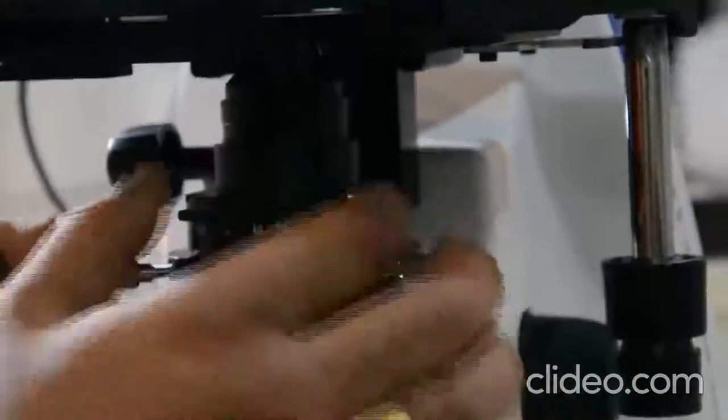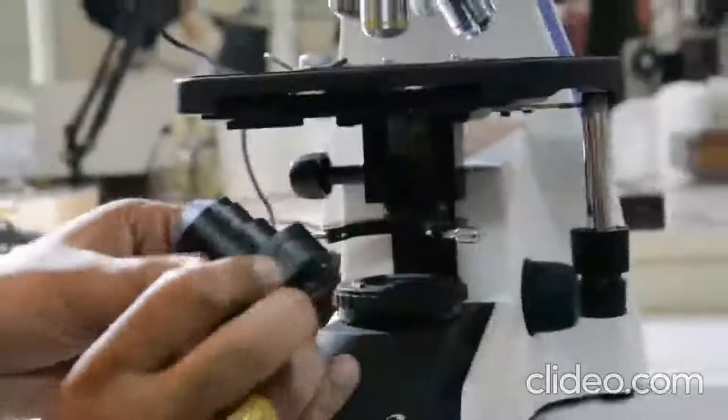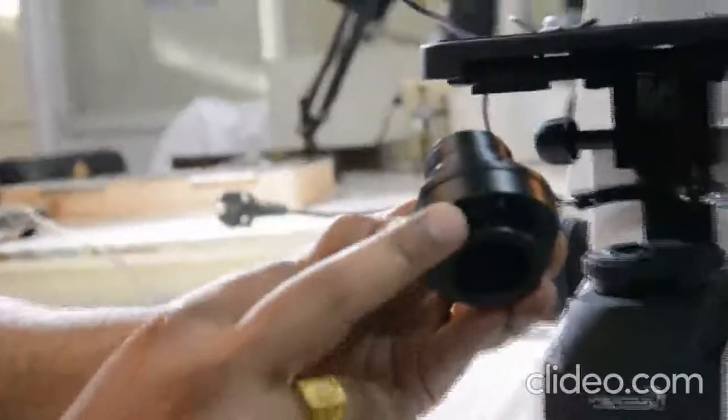You have to unscrew both the locks. Remove the condenser. As you see at the bottom of the condenser there is a pin.